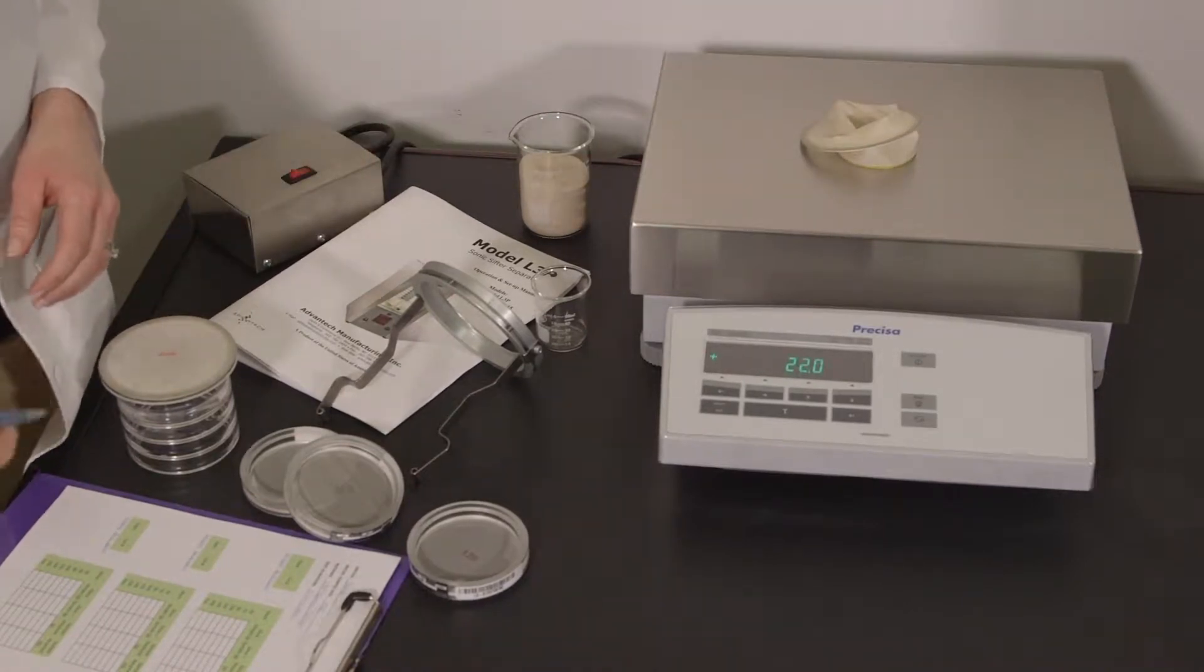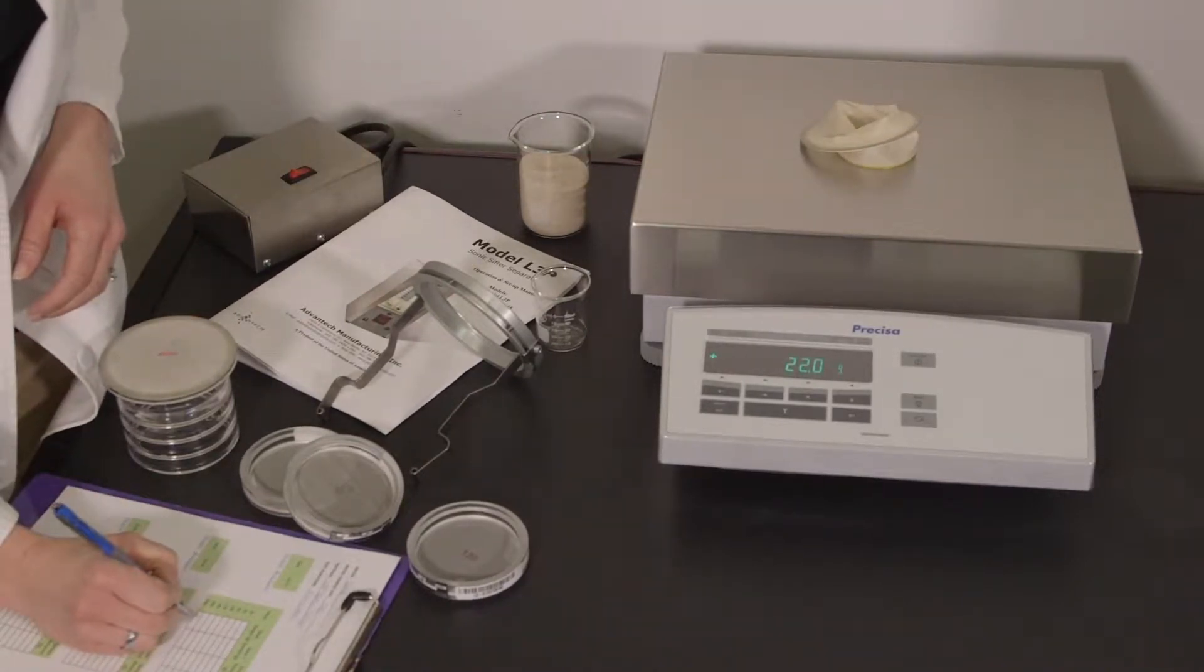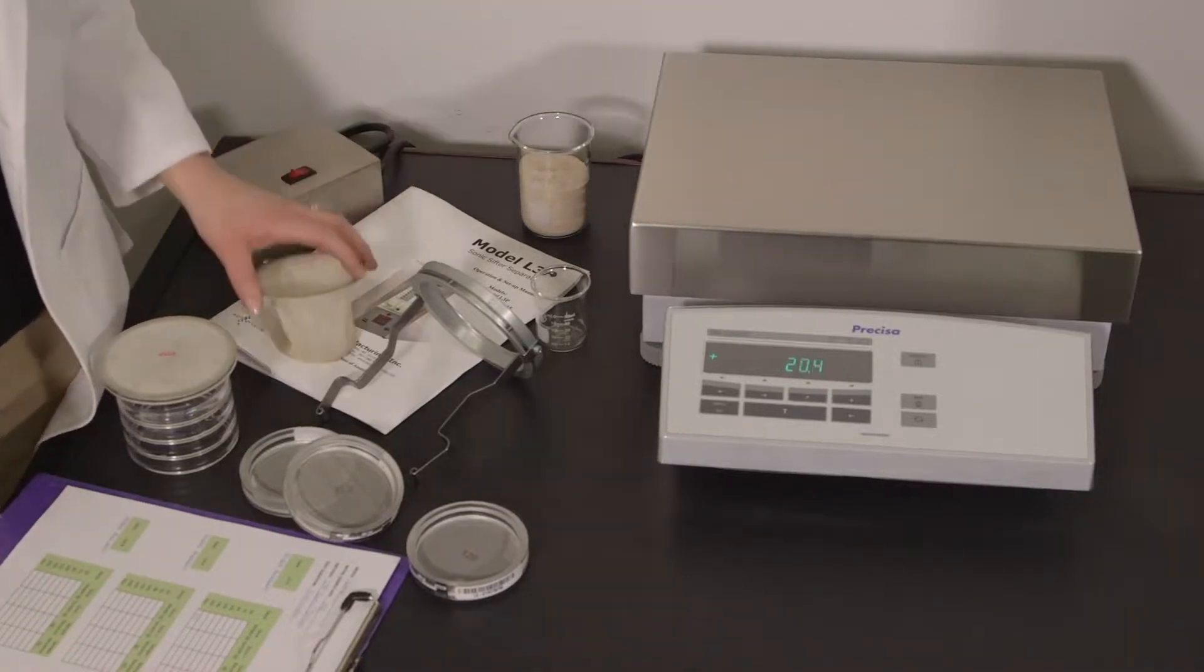Gather all the sieves required for your test, as well as your weighing device, means of recording your results, and a sieve brush.